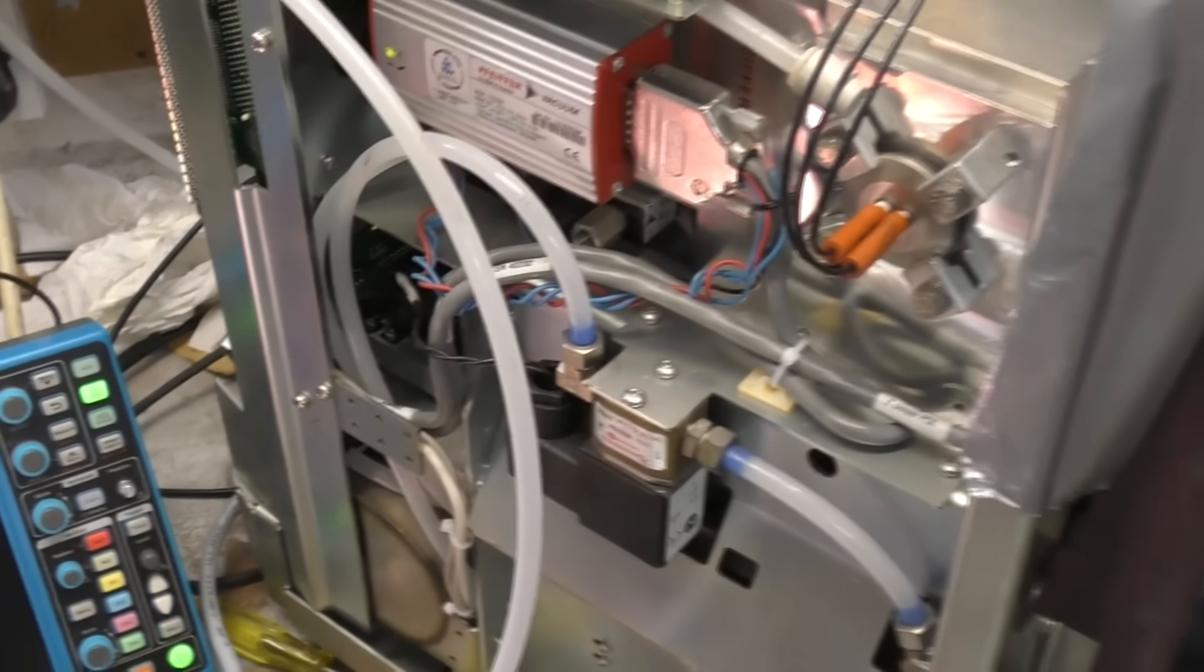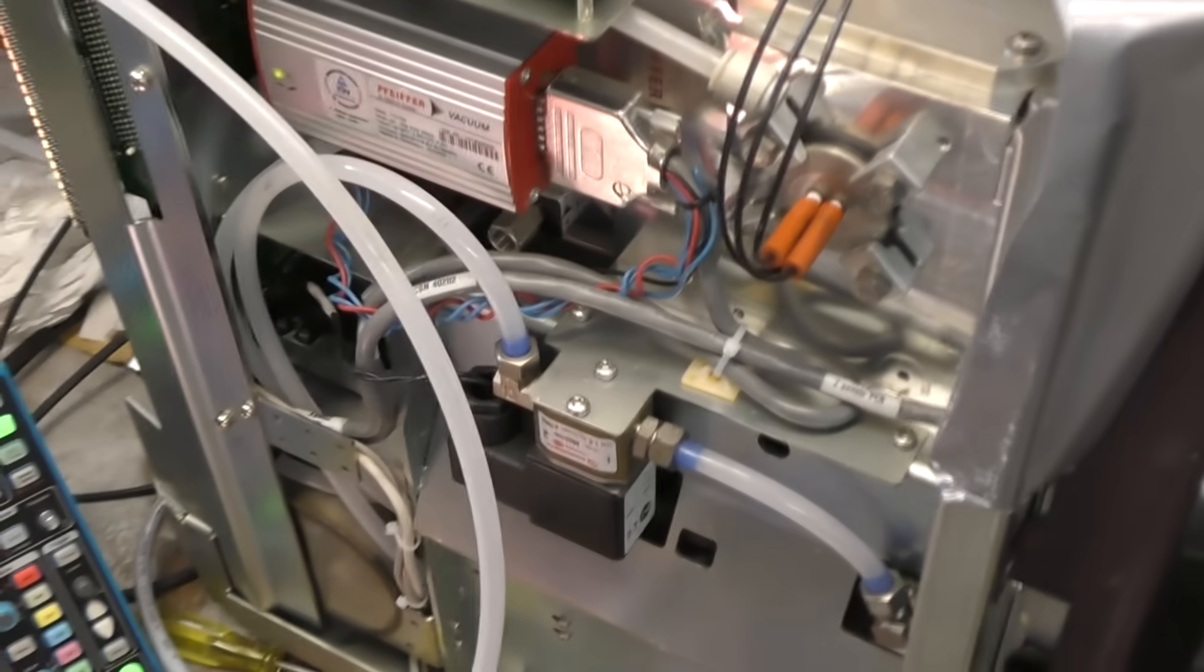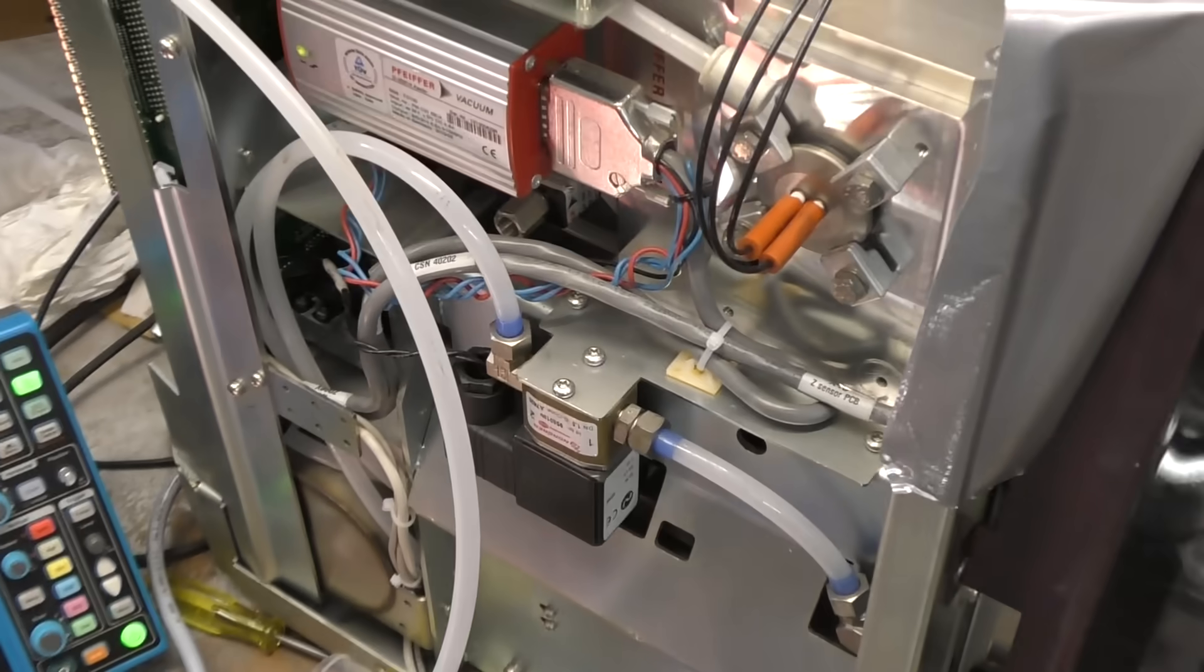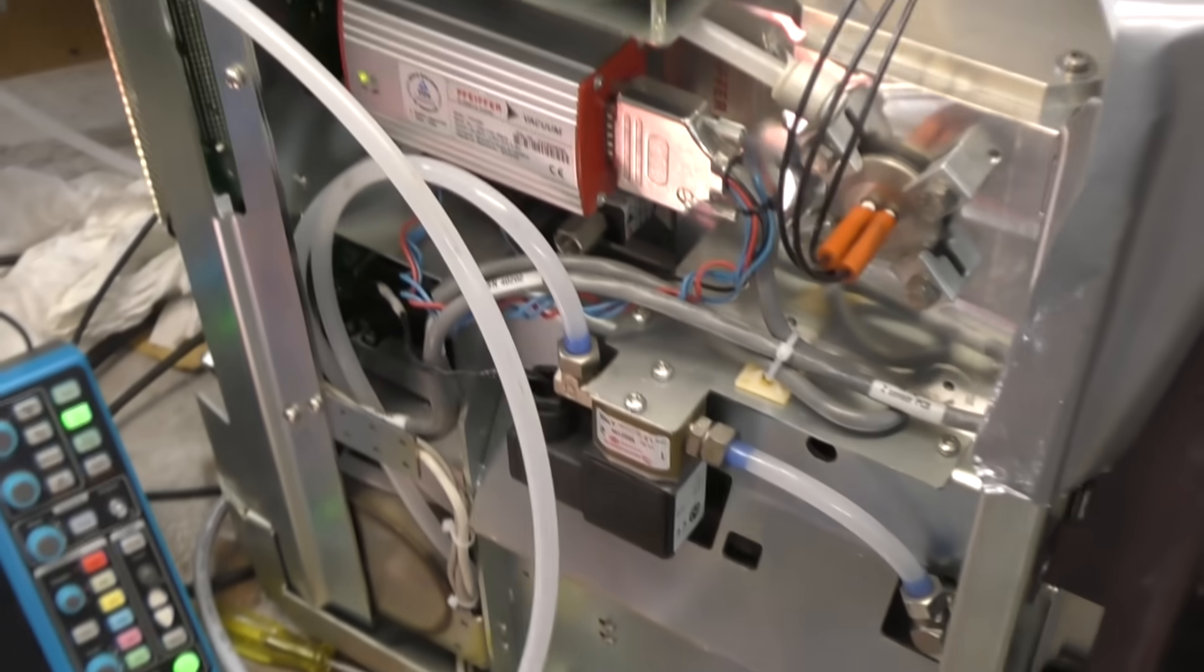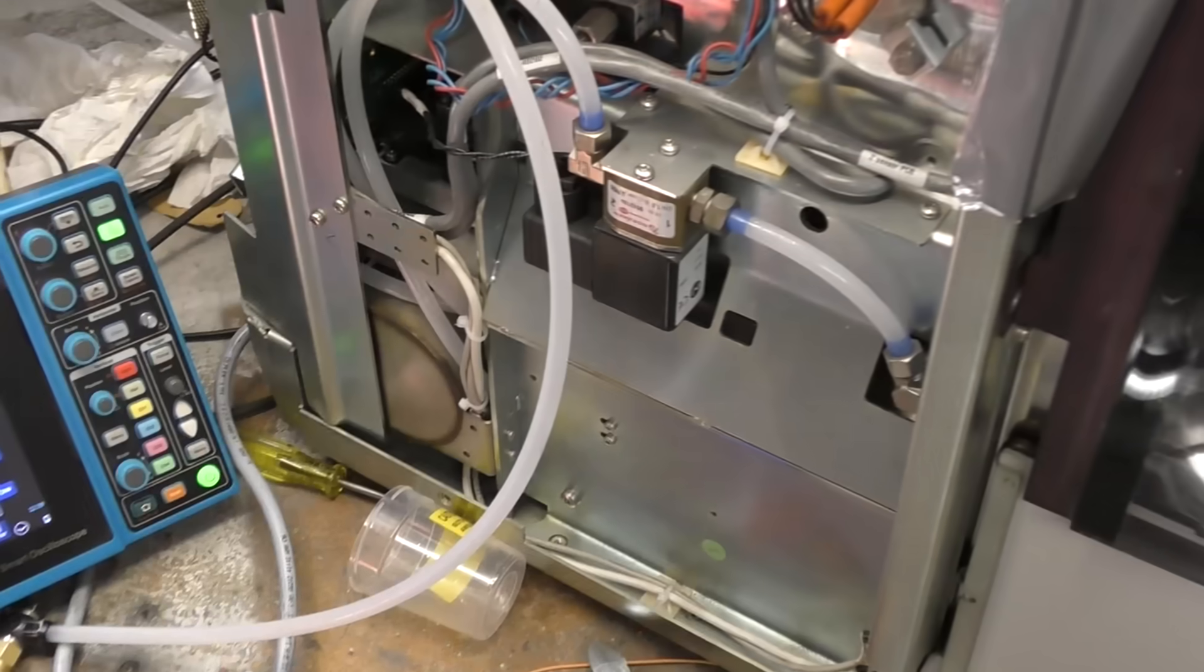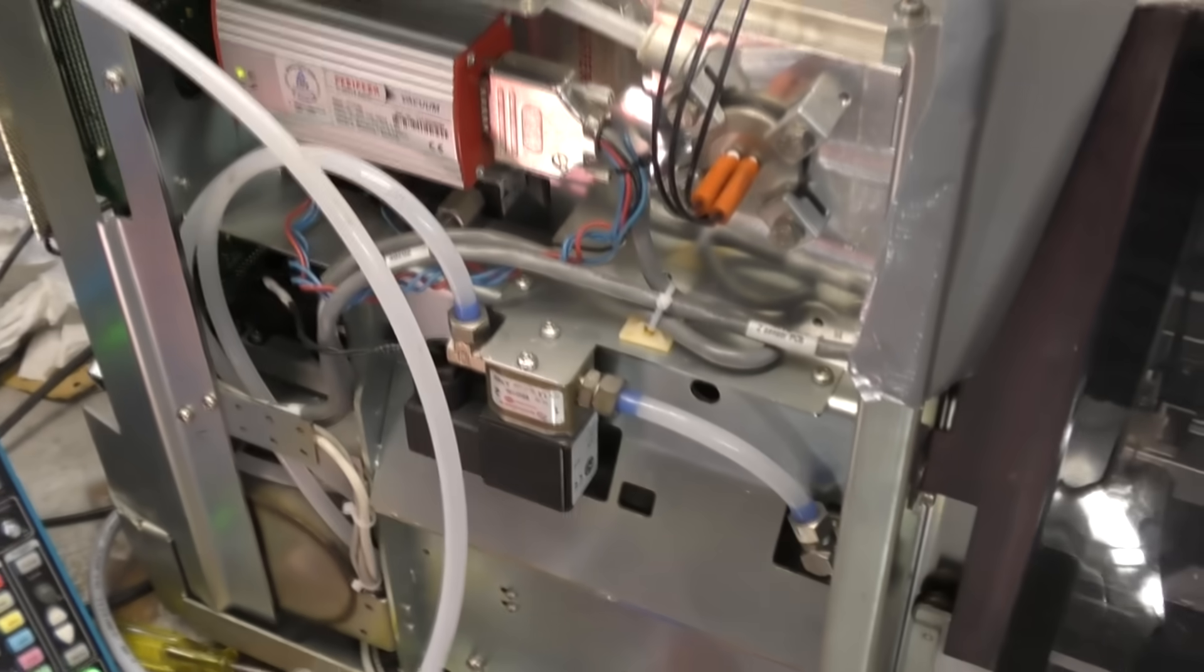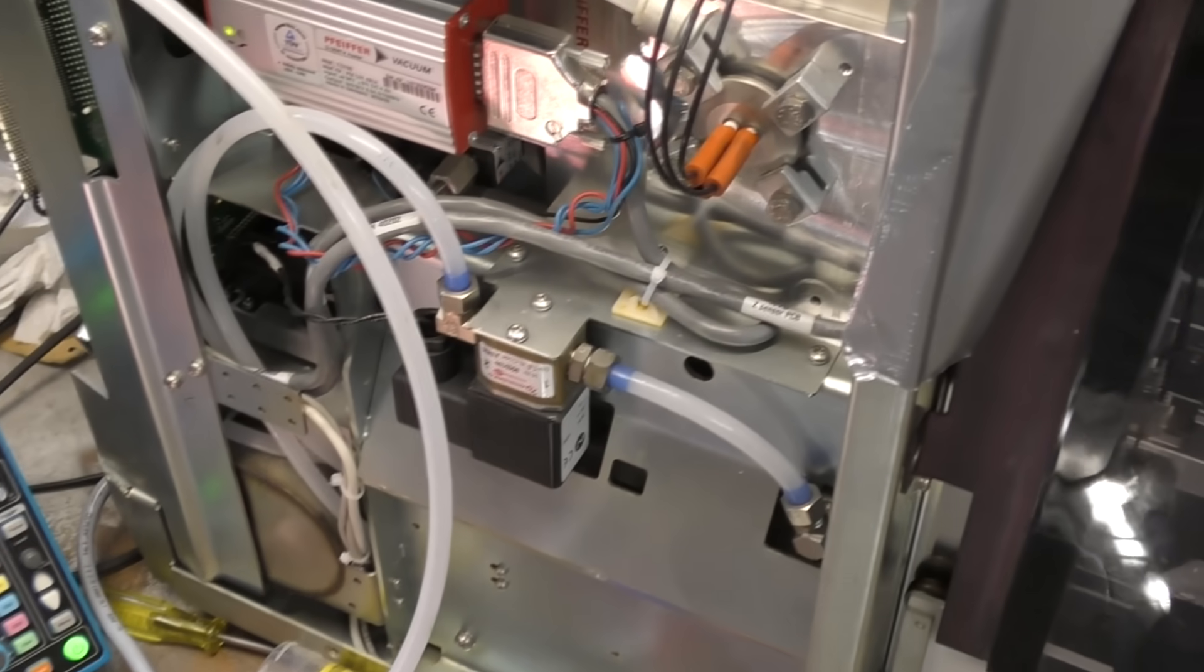Unfortunately, this confirms there is a problem with the filament or emitter on this thing. I'm going to pull this apart and delve into it. I don't really have time at the moment, so it might be a week or two before I get a chance to do that. Worst case, we'll get to see inside it and see what's happening. It may be feasible to just bodge some sort of tungsten emitter to get some image out of it.